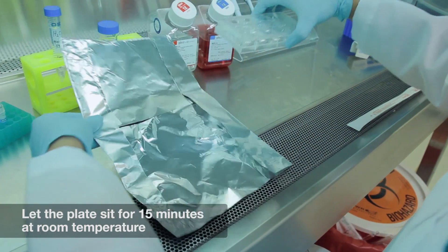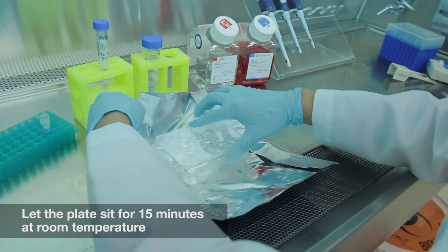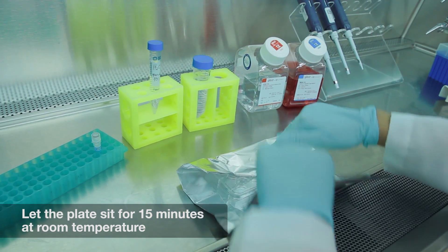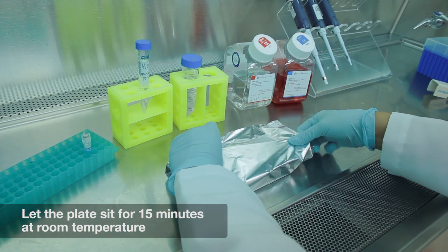Let the plate sit at room temperature for 15 minutes to allow the dye to permeate the cells and bind to the genomic DNA.